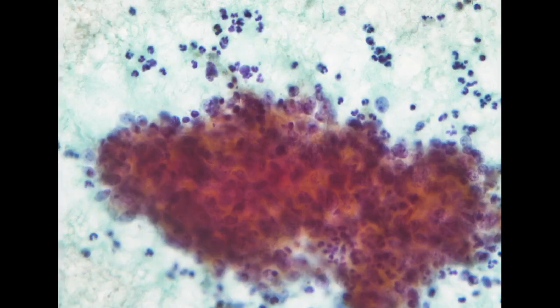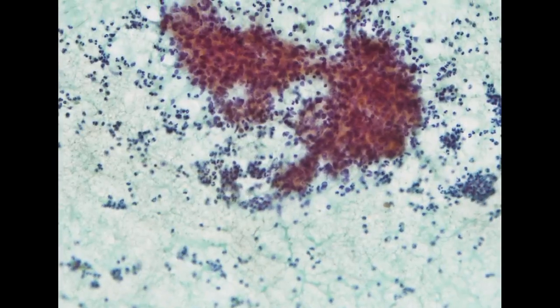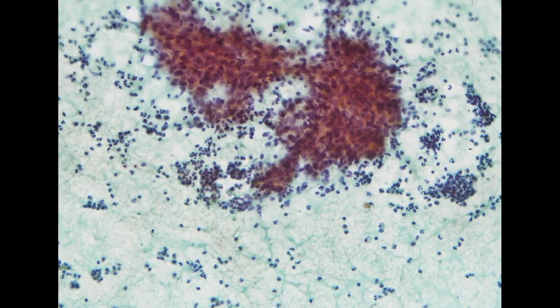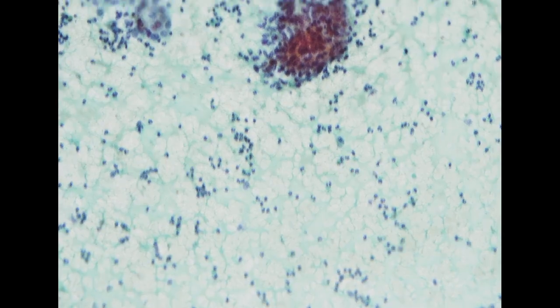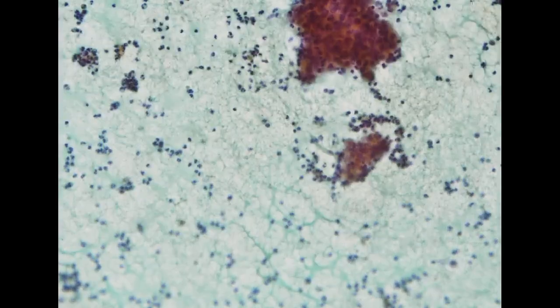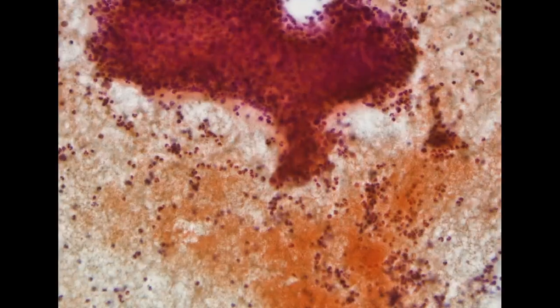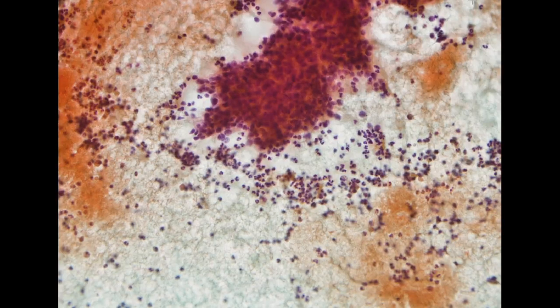And I think for this specimen, it is very, very difficult to confidently call this adenocarcinoma. I think most of these cells represent stromal cells with a lot of degeneration. We do not see any good area with a clearer glandular feature, with a definite type of atypia that we can safely call adenocarcinoma. So for this specimen, I'm calling it AGC, atypical glandular cells, favor neoplasm.